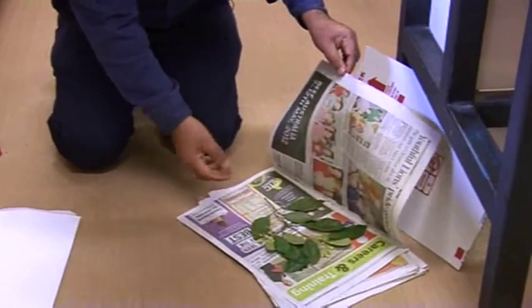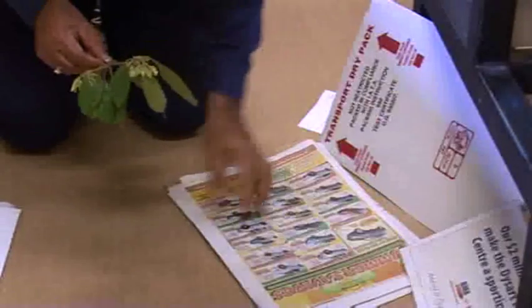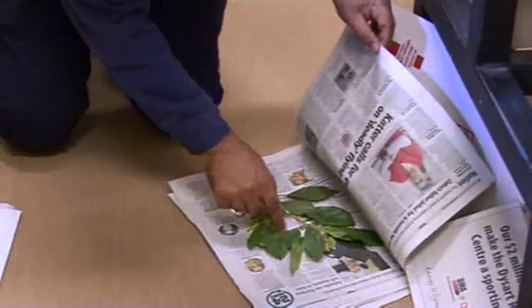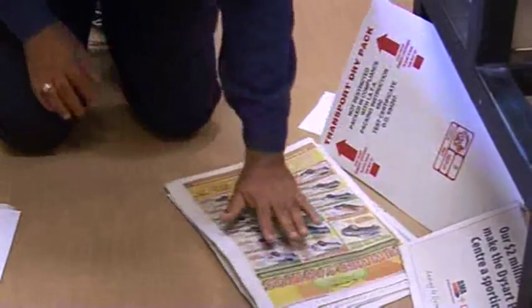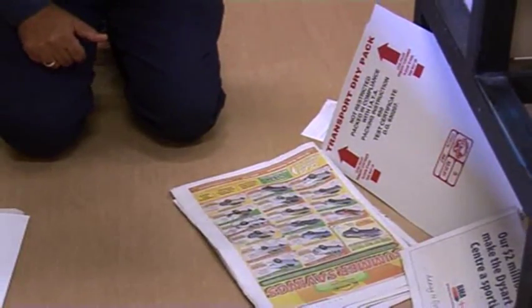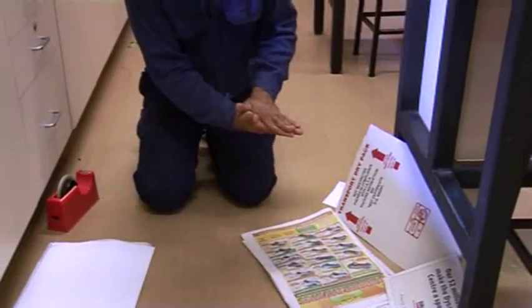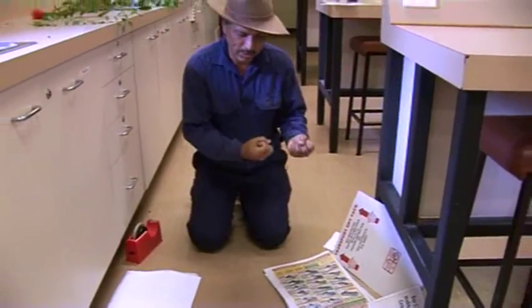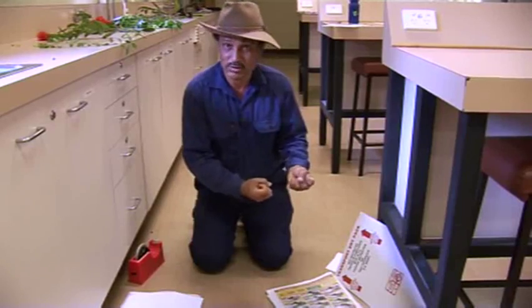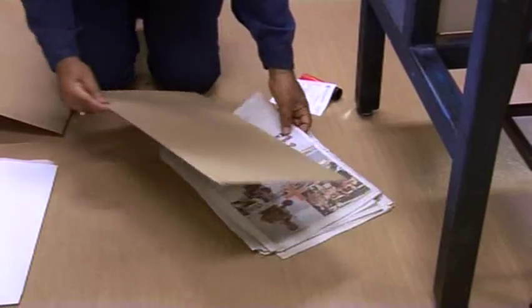Every three to four days, you need to change this one to the new sheet. And then put some heavy weight on that if you don't have a desktop plant press, so that all those samples get pressed and the moisture gets absorbed by the newspaper and the plant sample will dry out that way without heating it.